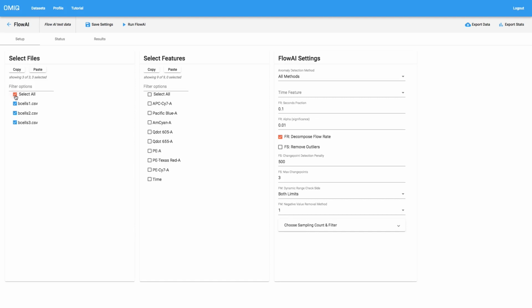And the next thing that we'll choose is which features or channels we want to include in the analysis. And so in our case, we do want to look at all of these parameters to find anomalies. So we'll choose all of them, and paying close attention to the fact that we're not going to be analyzing time in the same way that we're going to be analyzing these other channels, but we will be using time as a support channel for all the rest of these channels to be analyzed. So it's always important to choose time. Flow AI cannot be run without the time channel.